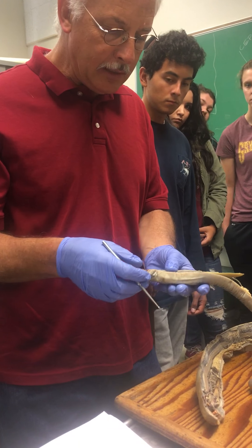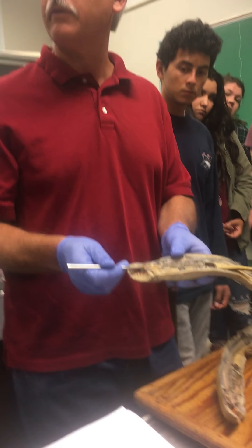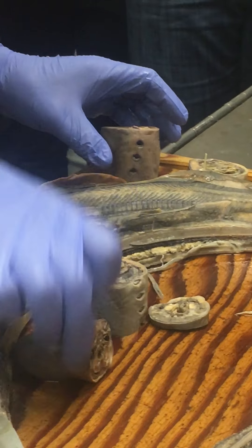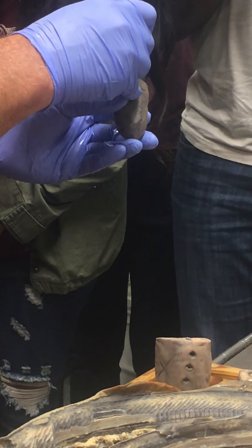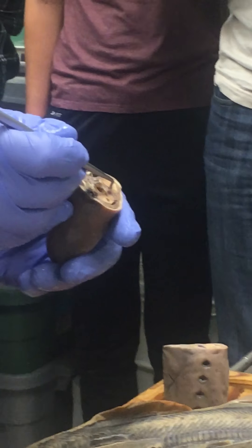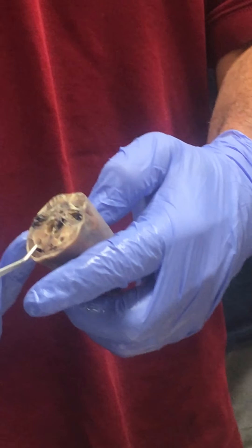The oral cavity is just the space around the tongue, which we've already seen. The oral glands can be seen in a cross section through the head region. These structures on the sides are the oral glands, and these are the anti-coagulating glands that keep the blood from coagulating so the lamprey can keep feeding.